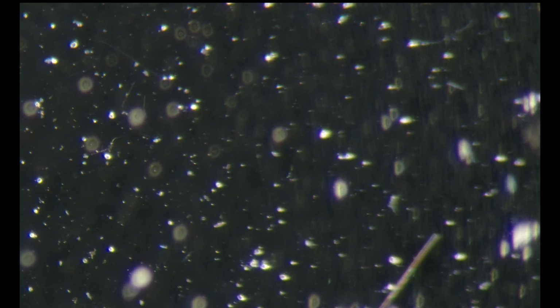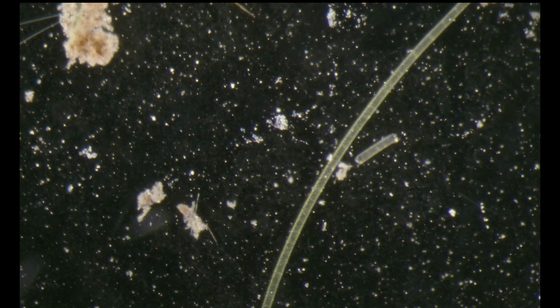You can see that even though I put it in not long ago, we already have, I'll zoom in, a very identifiable bacteria layer on the top of our water column. Right now it's about, I guess, 300 microns deep. Let's see what else we can see here.